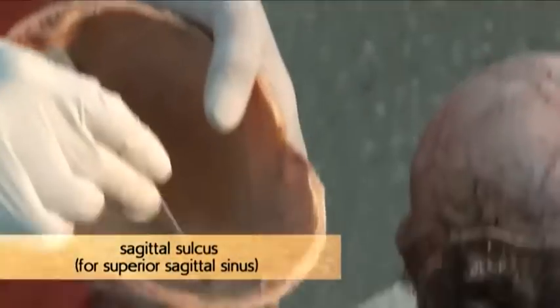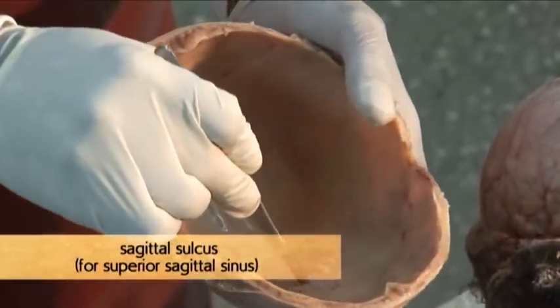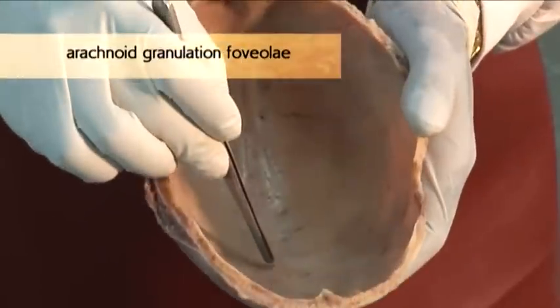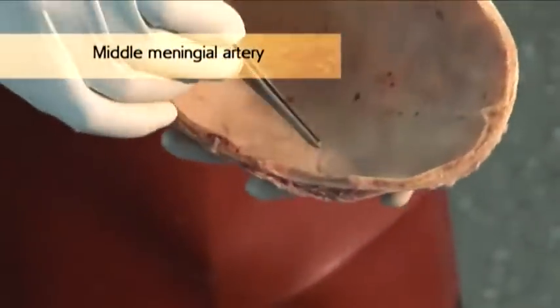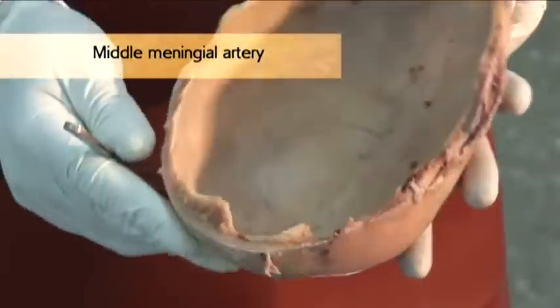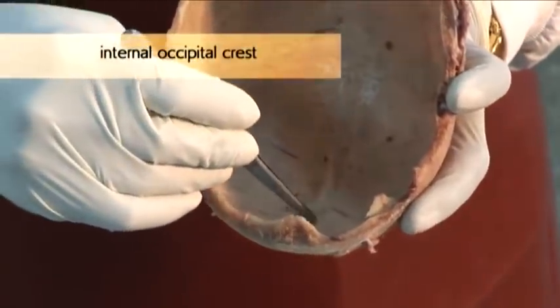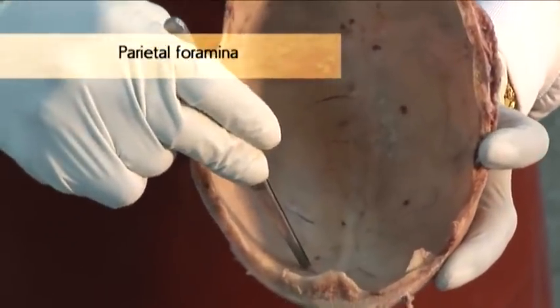We have the sulcus for the superior sagittal sinus. You have the frontal crest and a number of pits for arachnoid granulations. On the lateral side, we have the groove for the middle meningeal artery. At the posterior or occipital side, you see the internal occipital protuberance. That will continue down as the internal occipital crest. Then the opening of the parietal foramen.